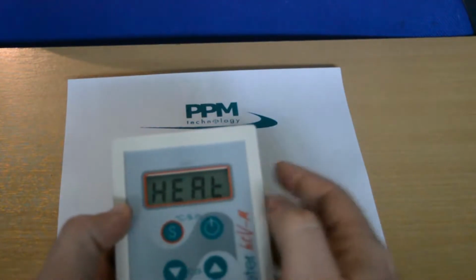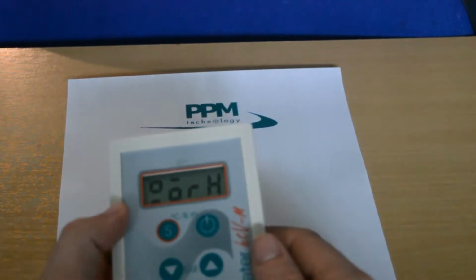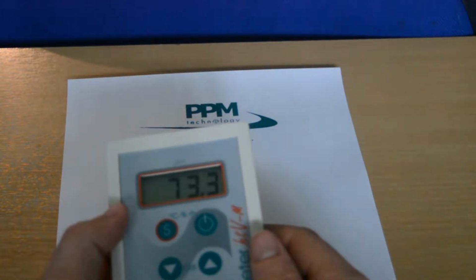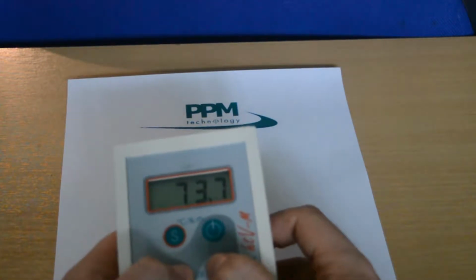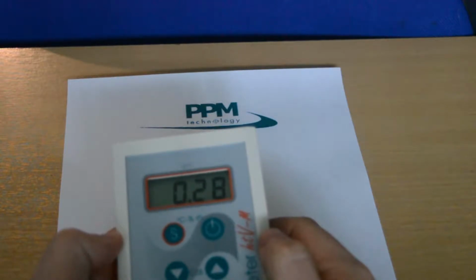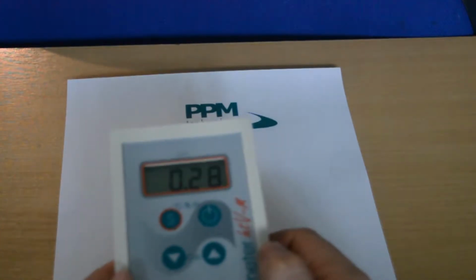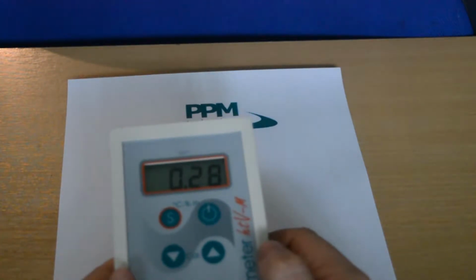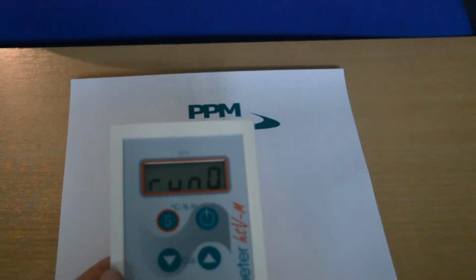The heat message will display, at which point you then need to release all the buttons held. Now press the down and up arrows to view the saved data. The display will briefly show data to confirm this. The display will then alternate between showing the saved sample number and the saved concentration in ppm. The samples are shown from the most recent run 0 to the oldest run 9.